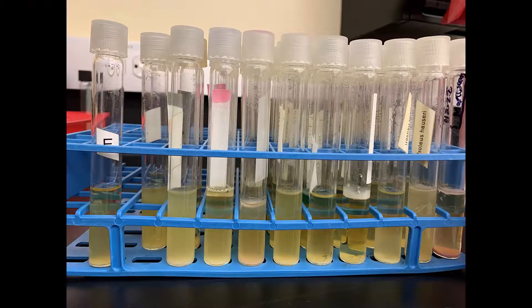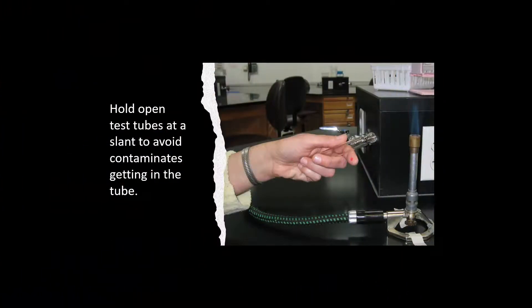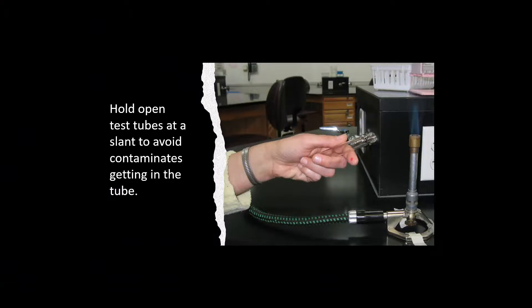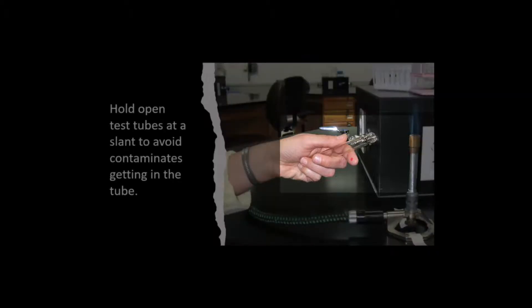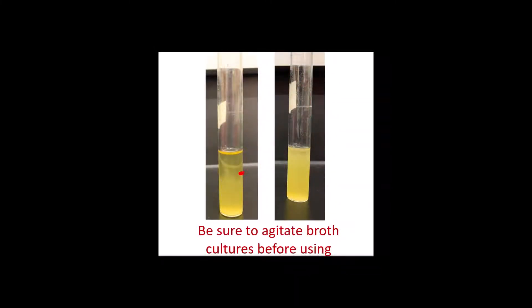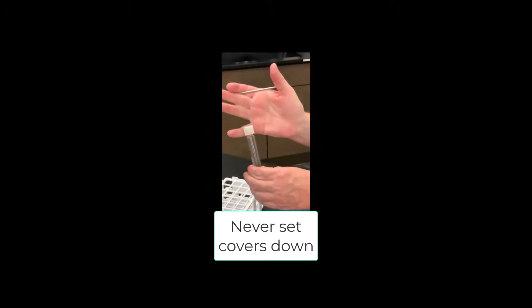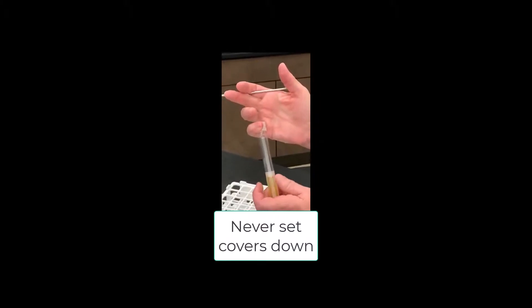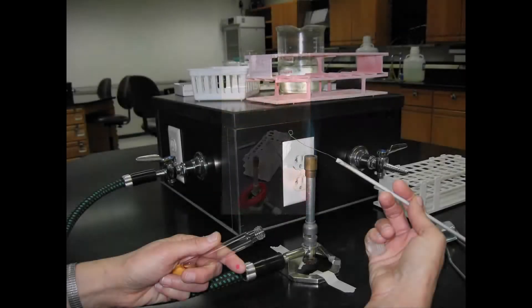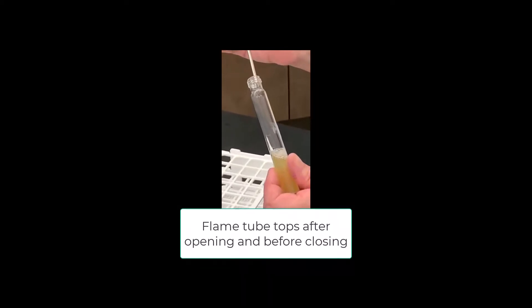When you're working with test tubes, always have your tubes in a test tube rack for stability. Just like Petri dishes, you want to prevent air contaminants from landing in the media. The best way to do this with a tube is to hold it at a slant whenever the top is off. If you're working with a broth culture, always agitate the culture before you loosen the top. Microbes tend to settle in broth cultures and agitation is needed to suspend them and get a good sample. To avoid contamination, tube tops should never be set down on the table. Loosen the top before you open it and then hold the cover in your pinky while the tube is open. Your instructor may ask you to flame the tops of your tubes when you open them and before you close them. Remember to do this quickly — you do not want to heat the glass.